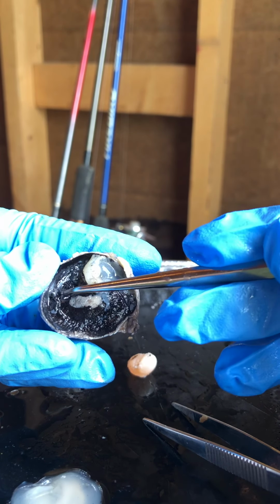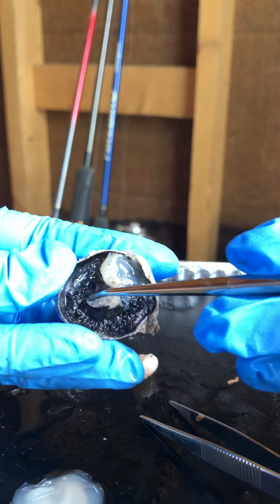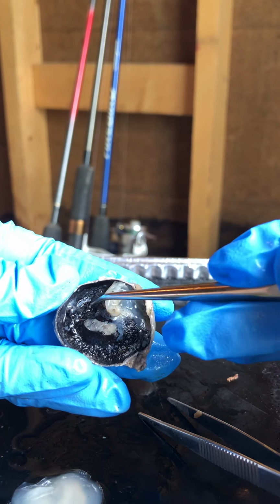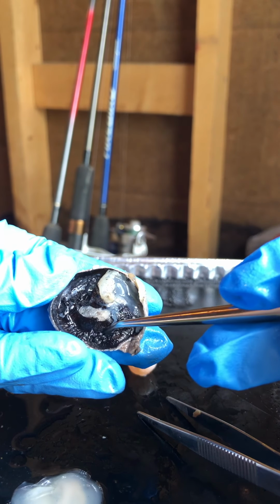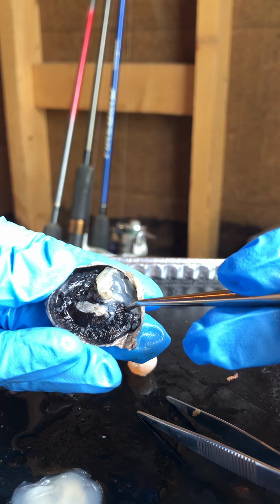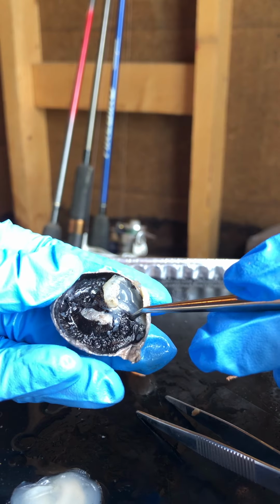this black striation, is called the ciliary body. The ciliary body surrounds the lens. Its function is that it is responsible for changing the shape of the lens.